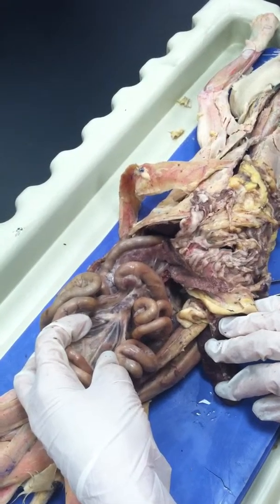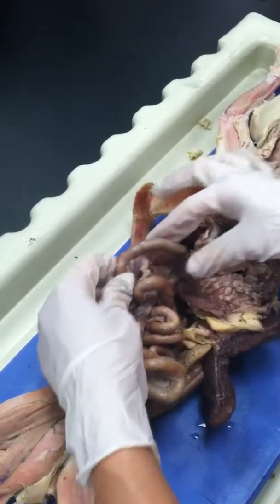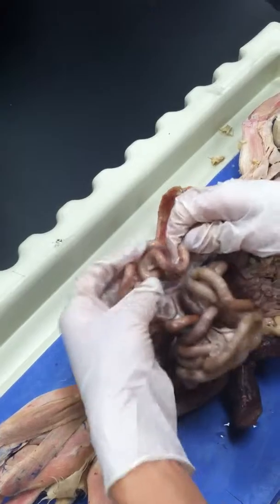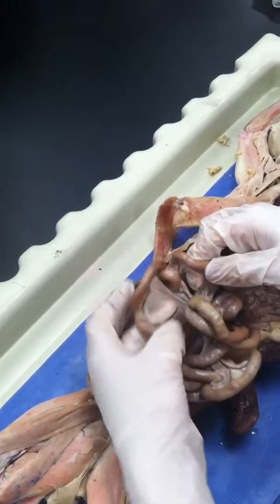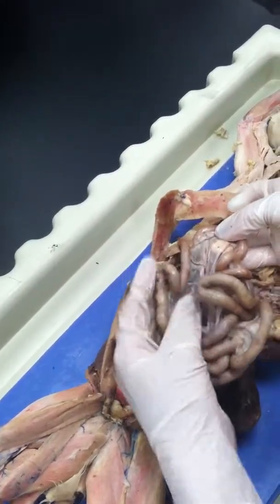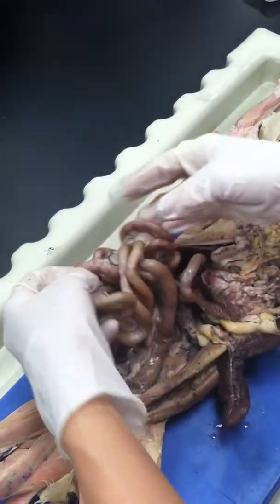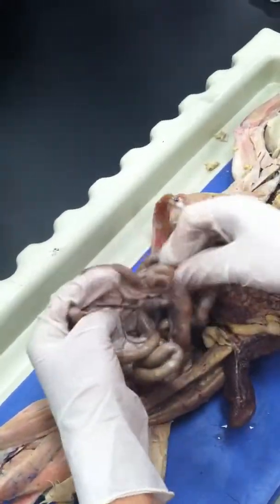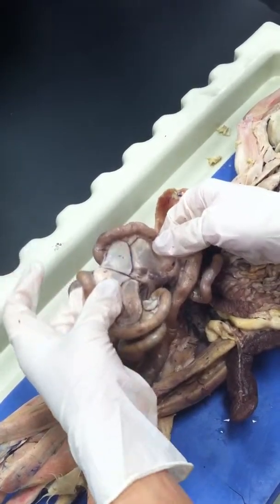If you start from just right next to the stomach, you have the duodenum, C shape. And then the jejunum, which starts to curve. In between the loops, you have what's called the mesentery, where the blood vessels go. Okay? And the last piece of the small intestine is the ileum. What is the ileum? It's the small part, the last part of the small intestine. Yes, like that.